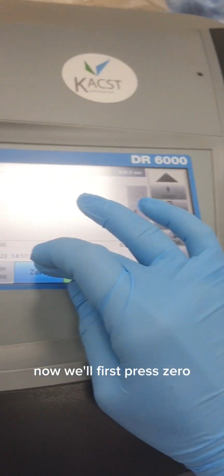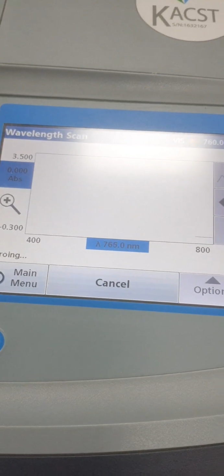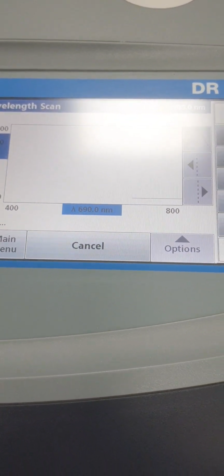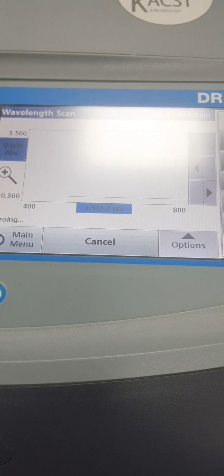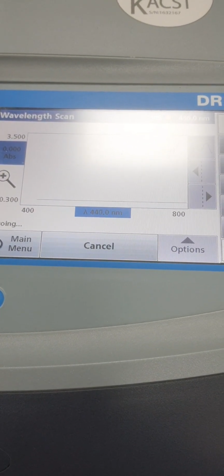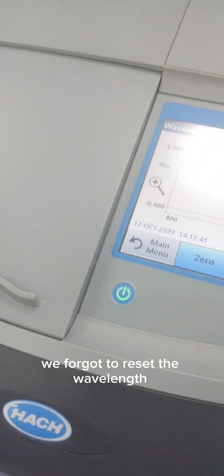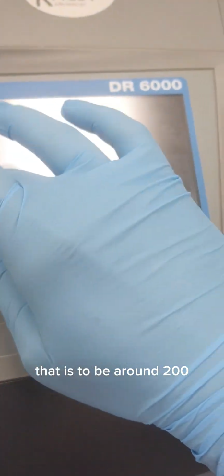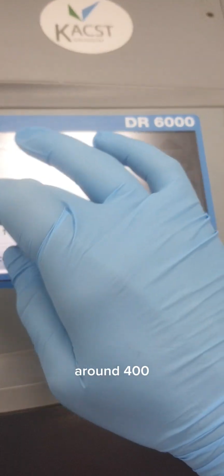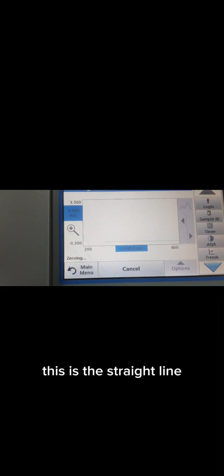Now we'll first press 0. We forgot to reset the wavelength, so we have to reset it here. That is to be around 200, and then here we will choose around 400. And then we'll zero it again. This is the straight line.